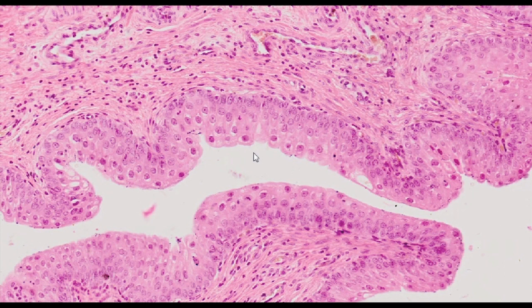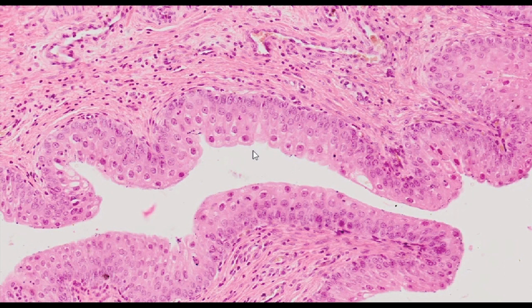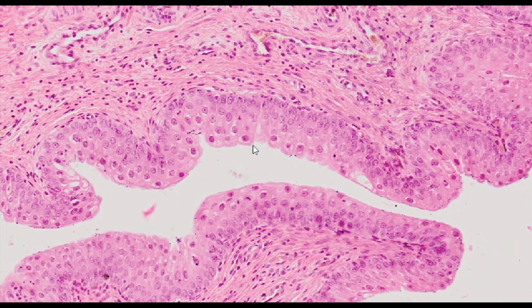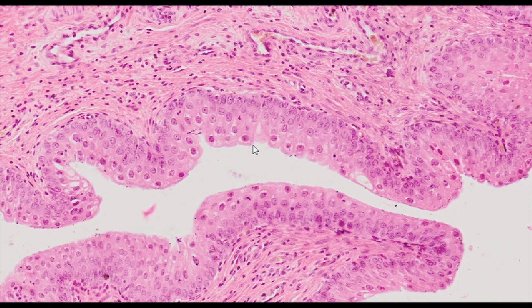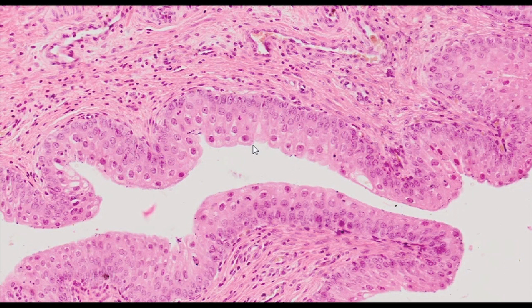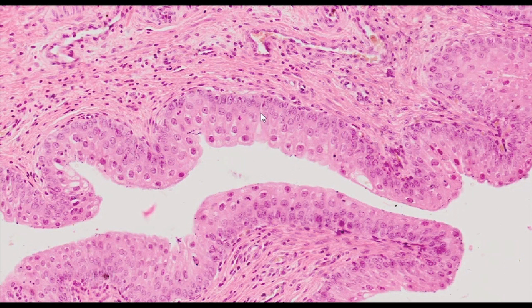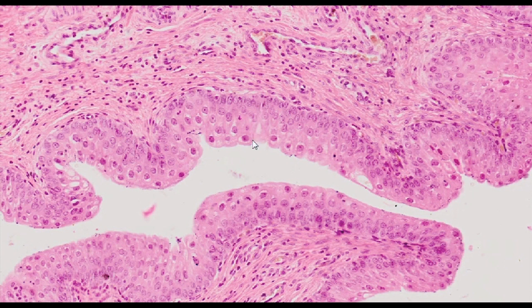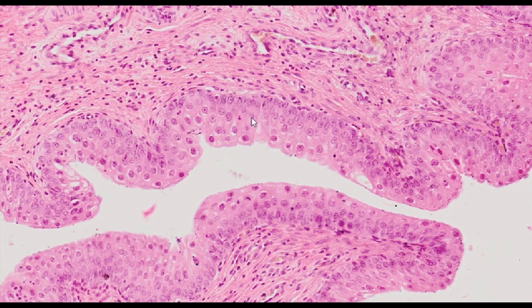Depending on the species, it is classified as simple, pseudo-stratified, or stratified epithelium. It is referred to as stratified cuboidal epithelium in humans. The specimen shows animal tissue, therefore the transitional epithelium will be referred to as pseudo-stratified.